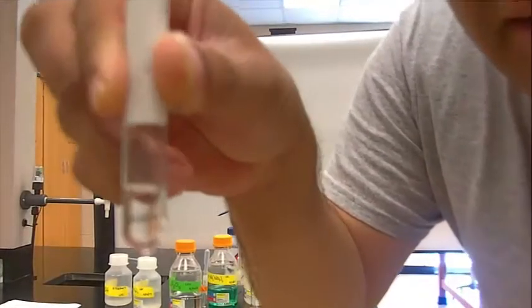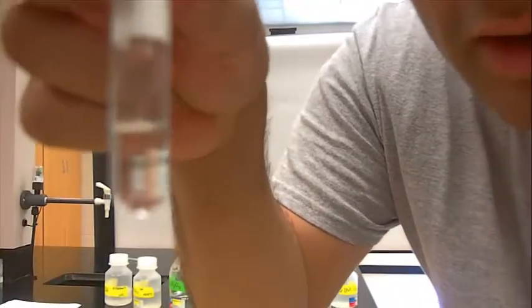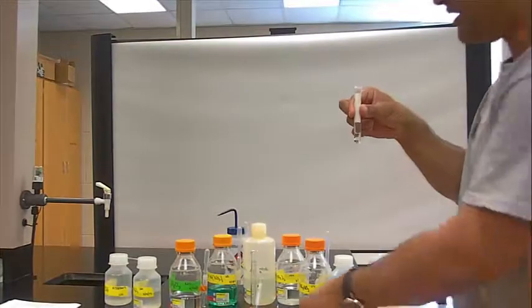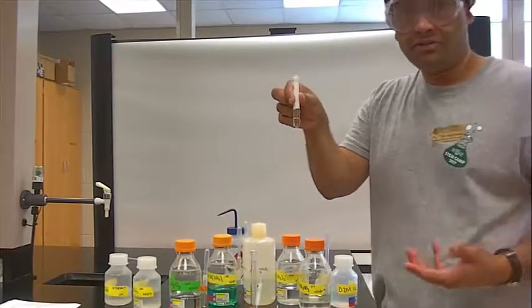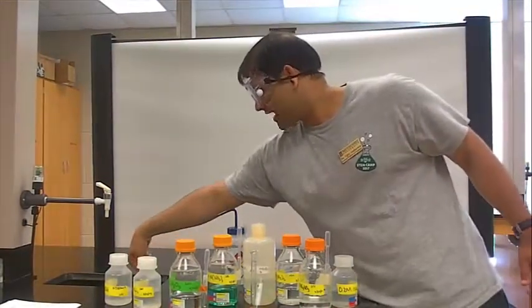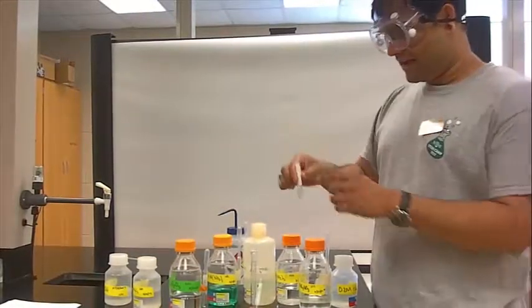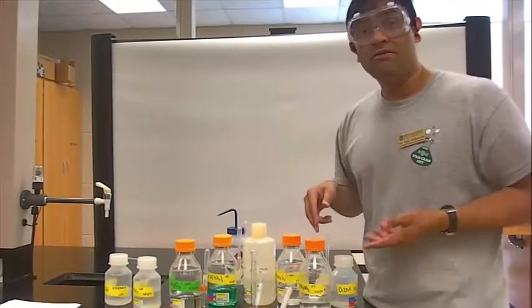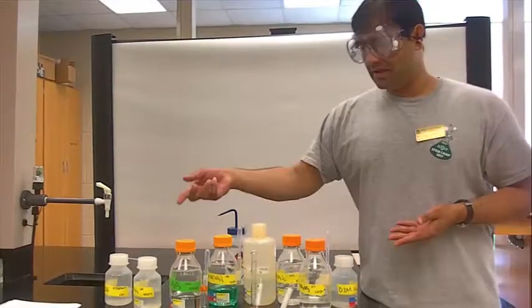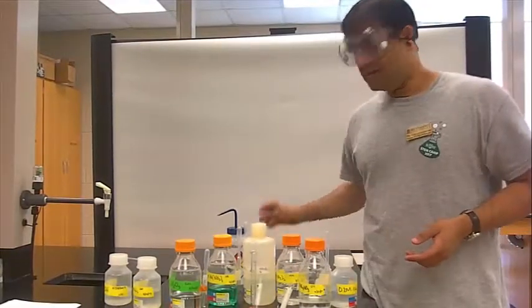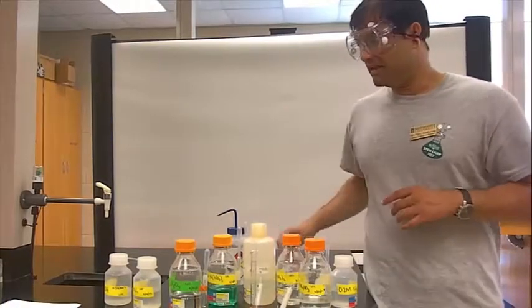We don't have to be so accurate or analytical. We are just concerning ourselves with an approximation. Now that I have my one mil mark and my two mil mark, I can dump this out. I'm ready to add one mil of one reagent to another mil of the other reagent, utilizing these plastic disposable pipettes.